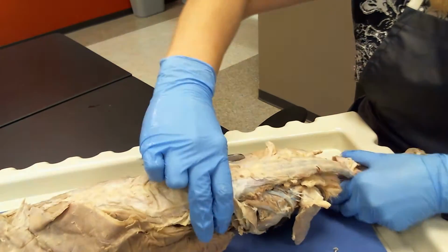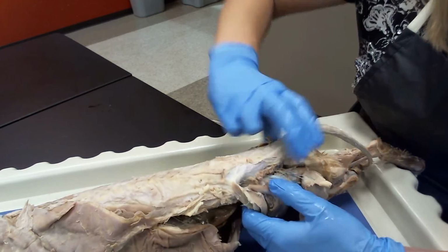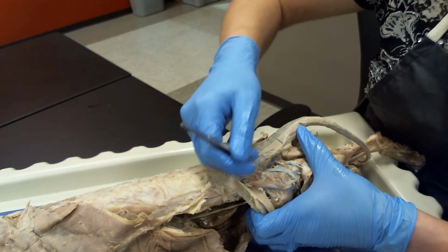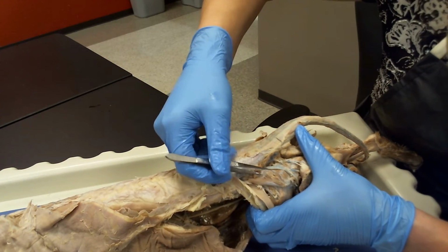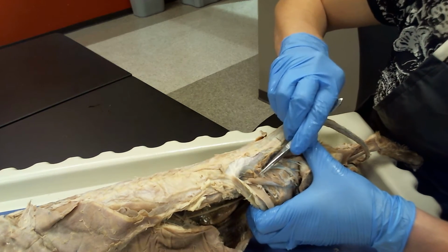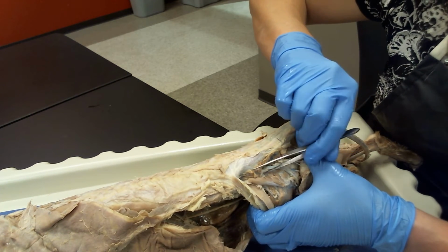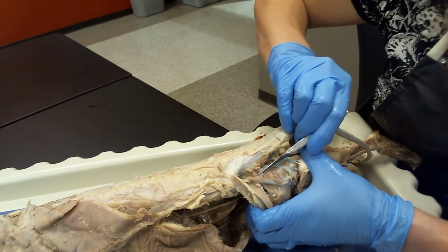Now, let's move on up here to the nerves right in the area, in the region adjacent to the sacrum and the tail. The first set of nerves that we're going to look at, these are the nerves that are coming out and going into the more superior or cranial gluteal area muscles, and these are your superior gluteals. You can appreciate those right there.